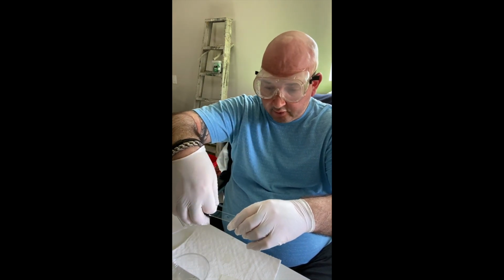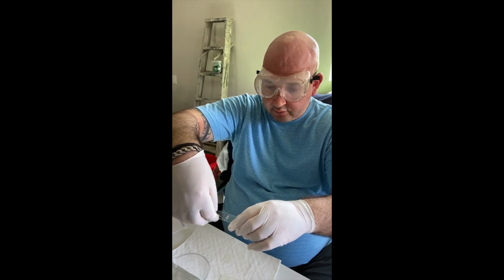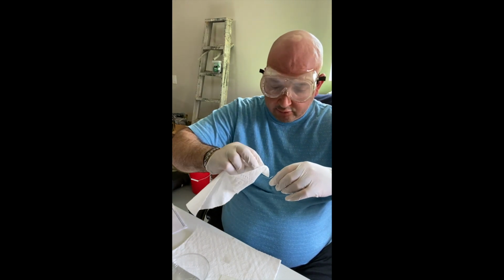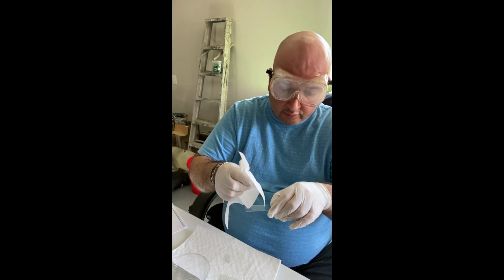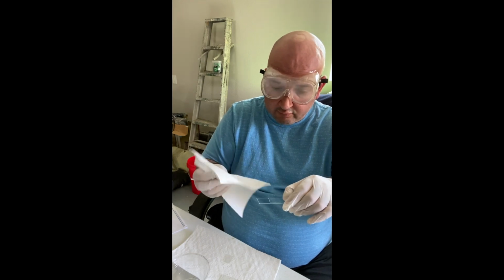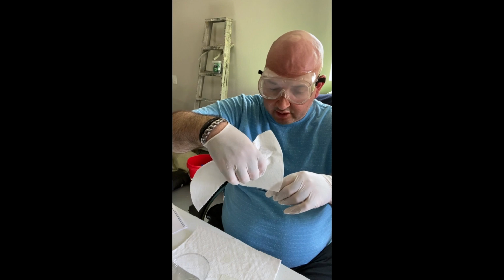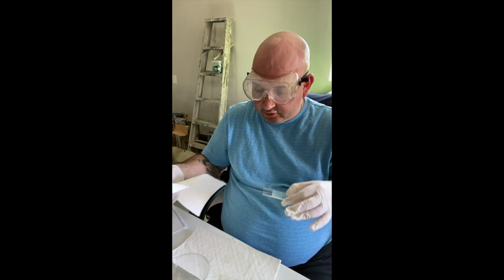My slide cover, and then just gently place the slide cover on the edge of the water and down. Now there is a tiny bit of excess water here, so I have a paper towel that I'm just going to dab with, and as you can see, the paper towel is absorbing the water quite easily, because I don't want excess water here, because it'll make viewing my cheek cells that much harder, especially since the cells themselves are not stained. There's no color to make them more easily viewable. Okay, so that's my cheek cells.